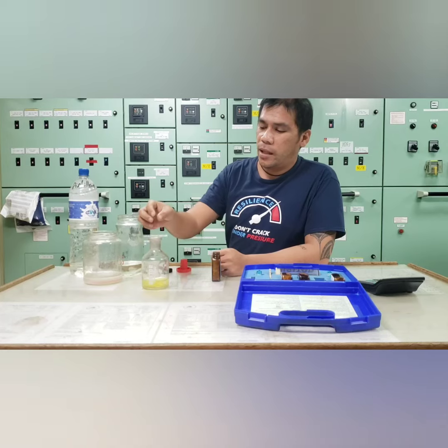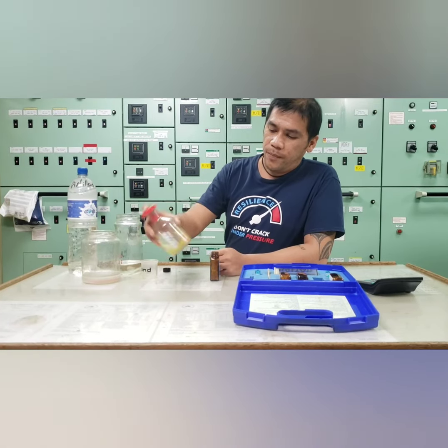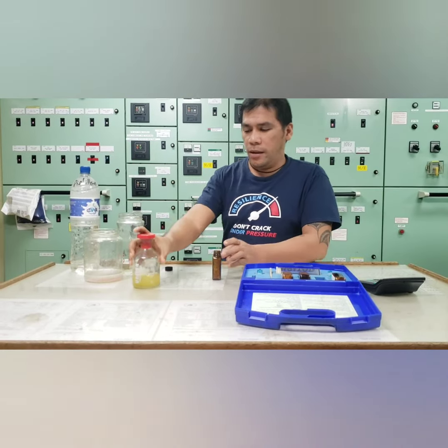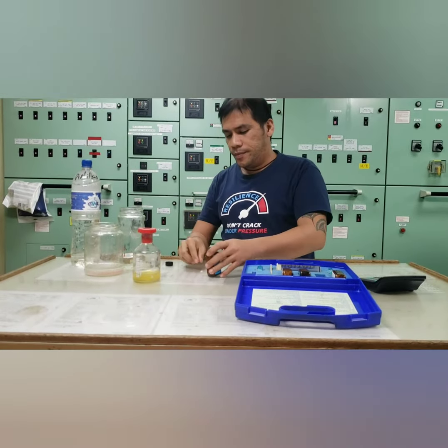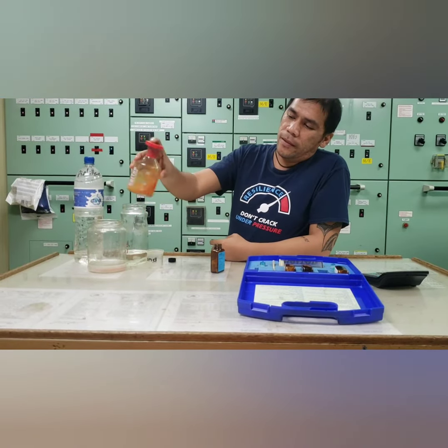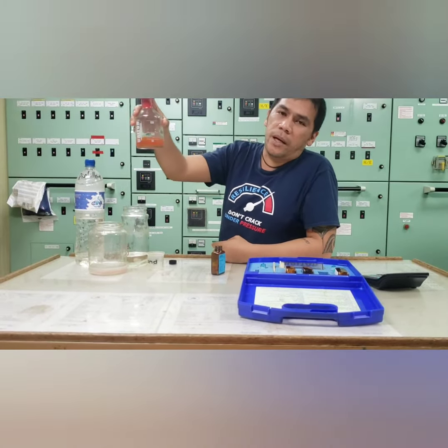Now we're going to add another tablet. Still yellow, another. So now it turns into red brown.